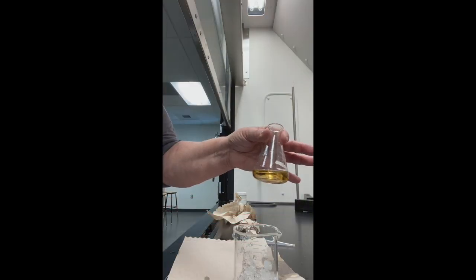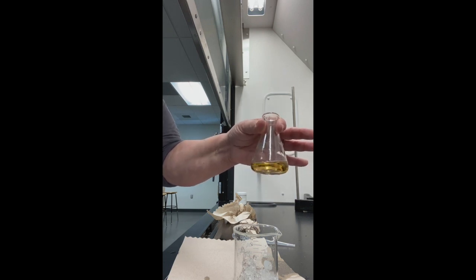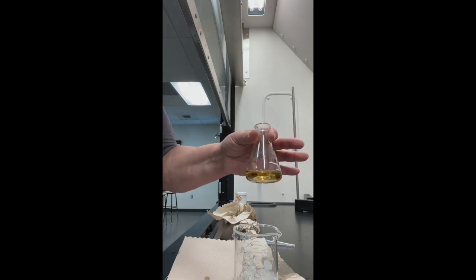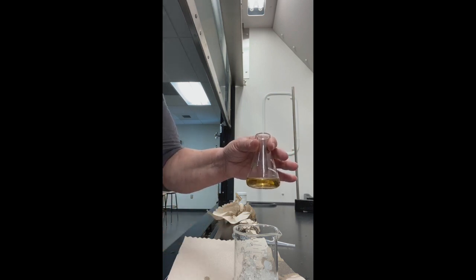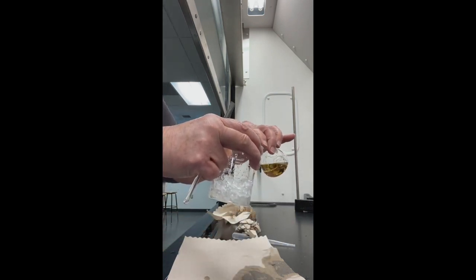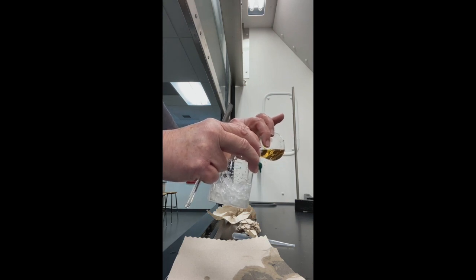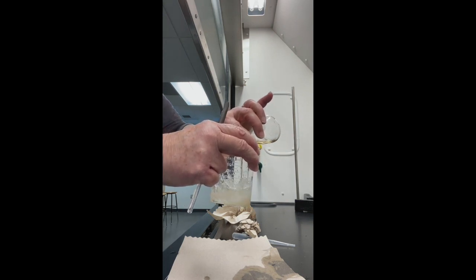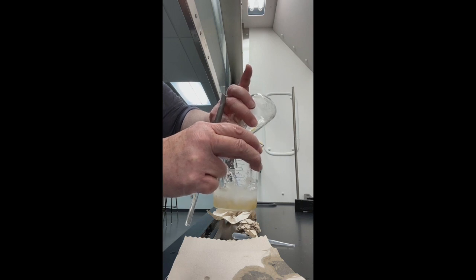It's been about 10 minutes. It's definitely been room temperature. Still note that we have the amber color going on. I have my 30 grams of crushed ice right here. I'm going to add this to the crushed ice.